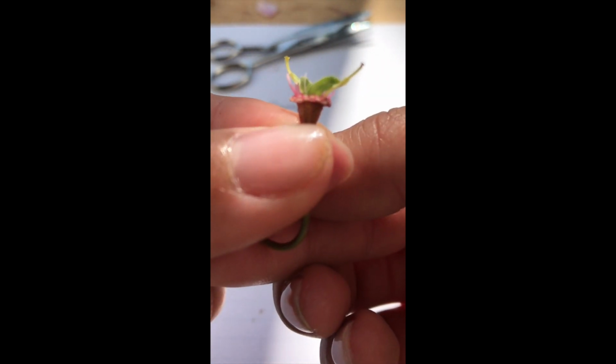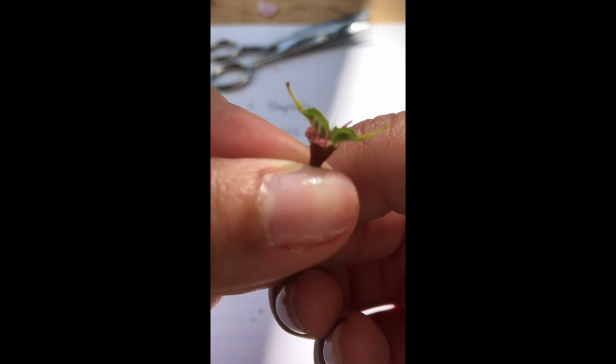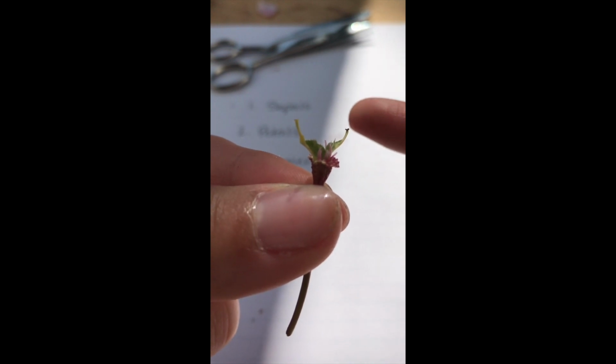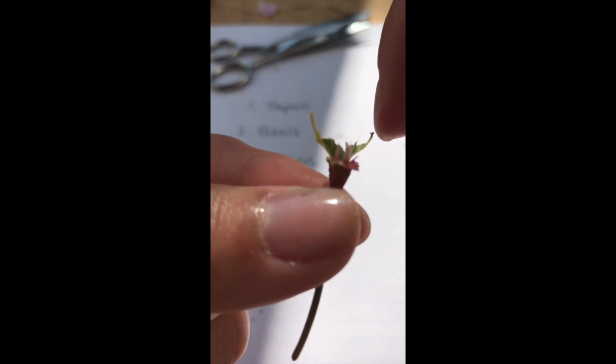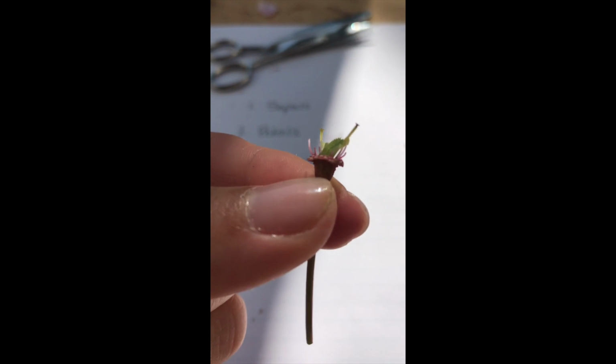And if you notice, they almost look like little suction cups sort of at the top, or like a little mushroom head or something like that. So that little part right at the top is sort of that landing platform where pollen is going to come in and touch onto the pistil, and when the pollen lands there, then the fertilization for the flower can happen.